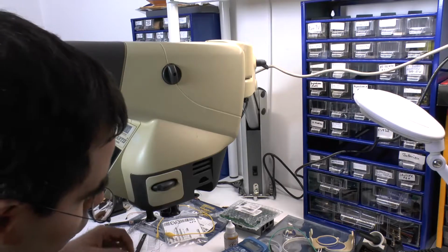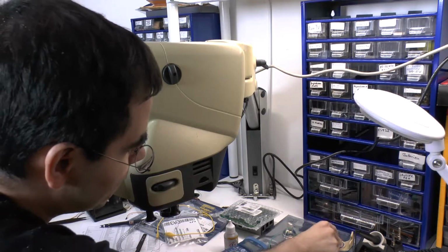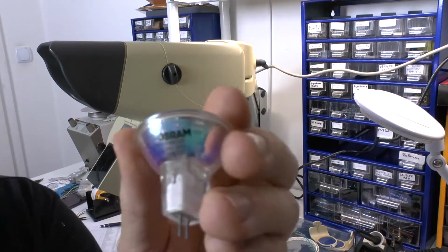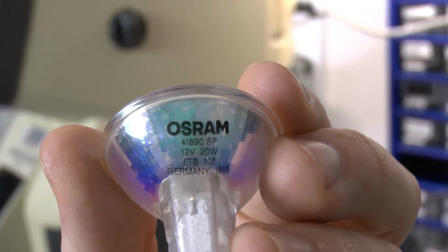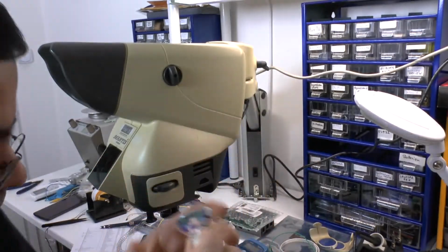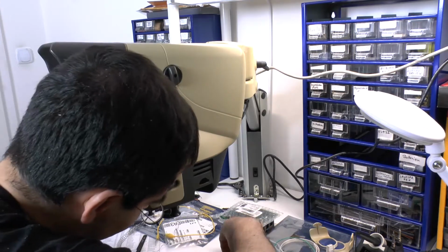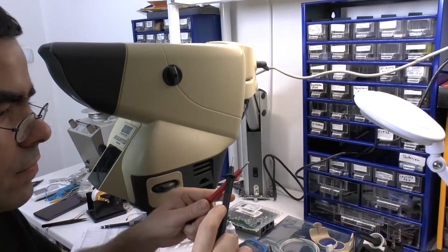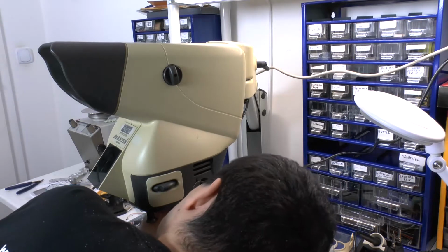So, I already removed these two deflectors here from the side which hold the lamps, and I took out one of the two lamps. These are by the German company Osram, and I'll try to zoom in a little bit so that you can read the type. And yes, there is no shield in front. So now I took one of them out and now I grab the meter. It's a habit of mine, whenever I grab a meter, first I test it. And then I go in and I beep these two points.